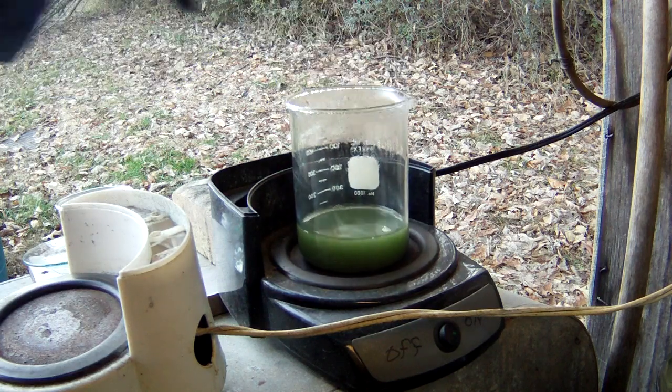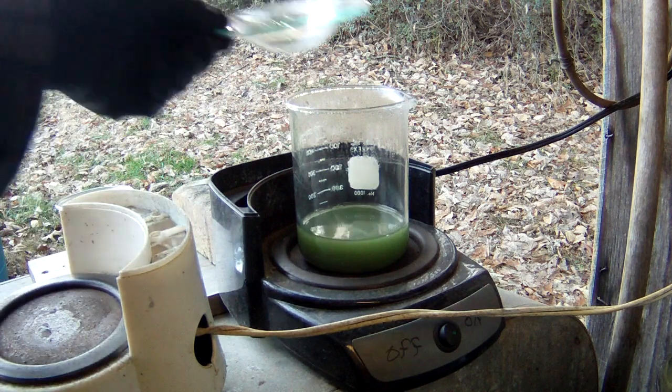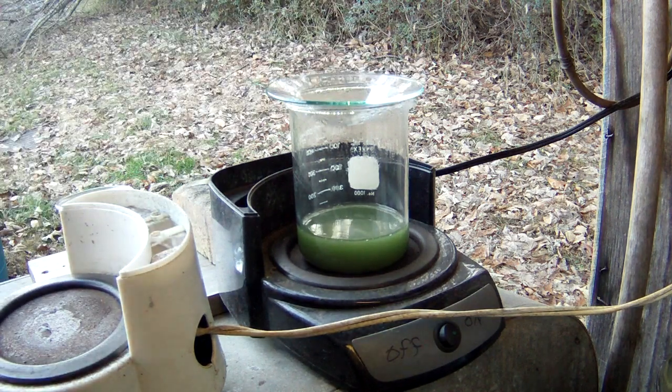So let's let that heat up and see what happens. Yeah, she's perking up a little bit, so we still have some silver in there. So, as always, we're just going to let it go. That's one thing about this. This is just something you can't rush. It does what it's going to do when it wants to do it.